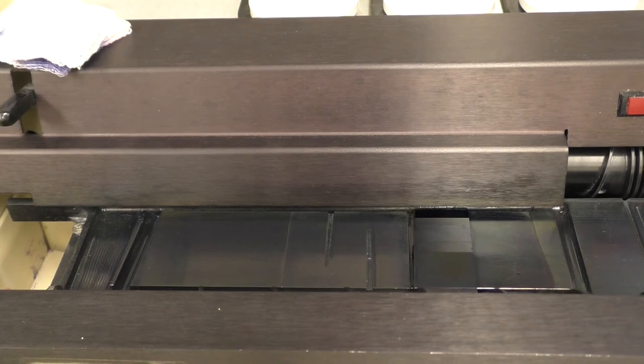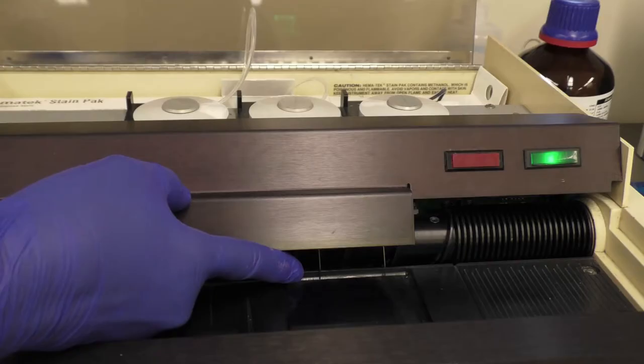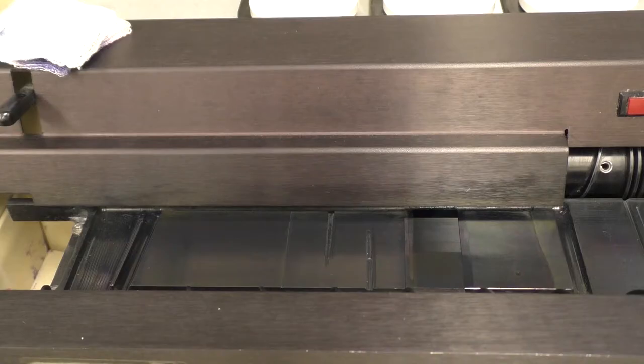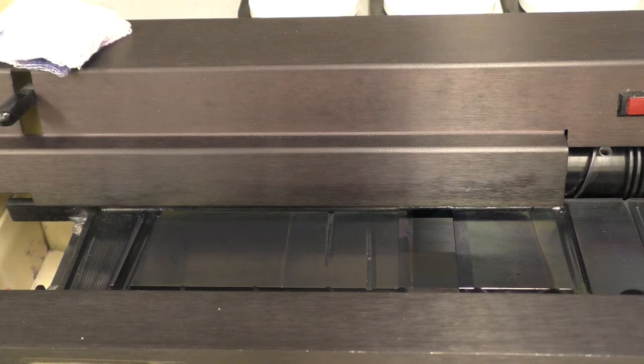The slide then advances to come in contact with the buffer sensing switch finger. A metered amount of buffer solution is added to the stain to achieve a one to two stain-to-buffer dilution.